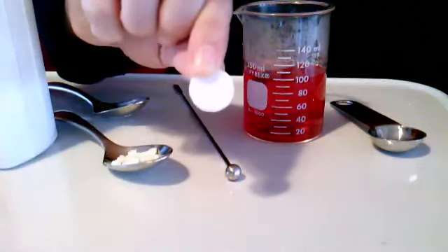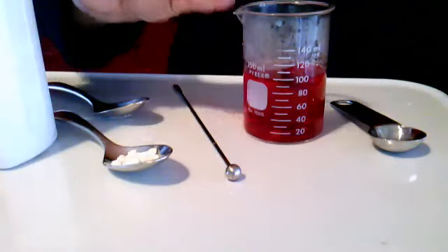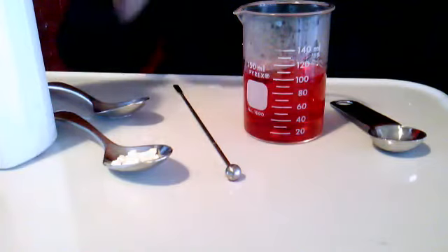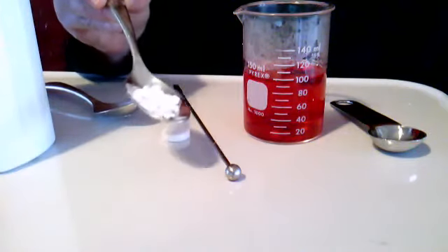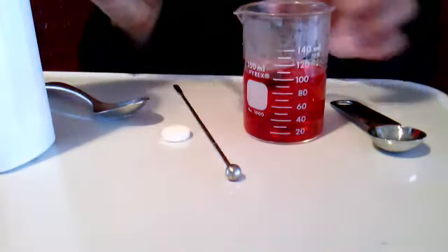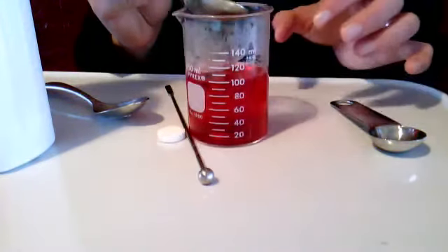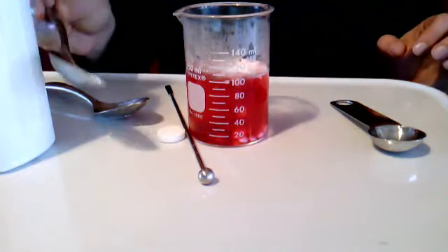Now, when you have a Tums, if any of you are so lucky to have had stomach troubles that you needed one of these things, you don't swallow them whole. So we're not going to drop it in whole. You generally chew it. So I did pretend chewing on this one by just smashing it between 2 spoons. And we are going to add that, so watch closely here. We'll see if anything happens.